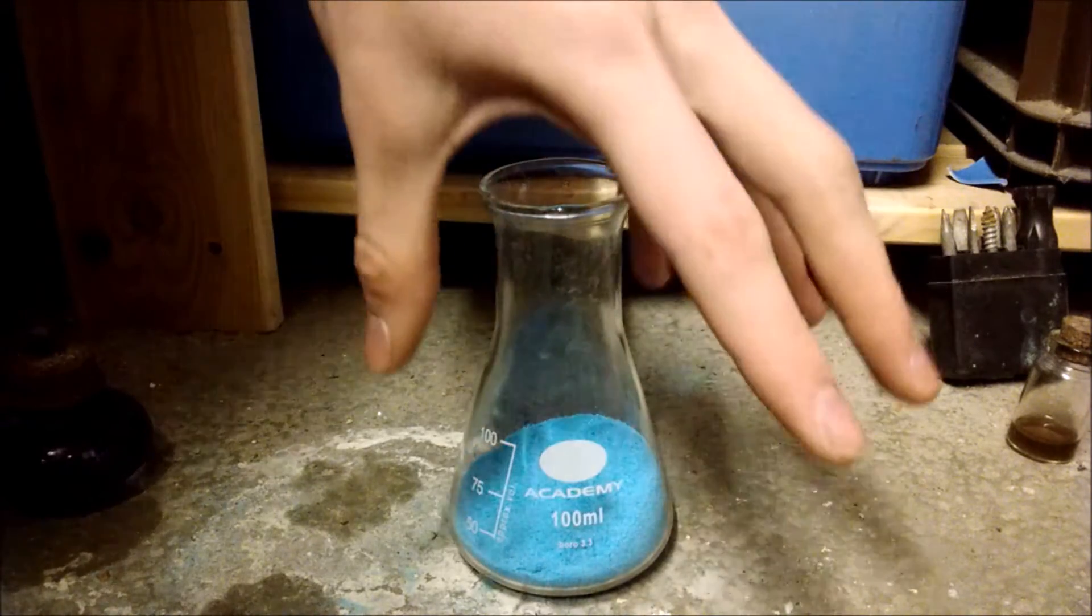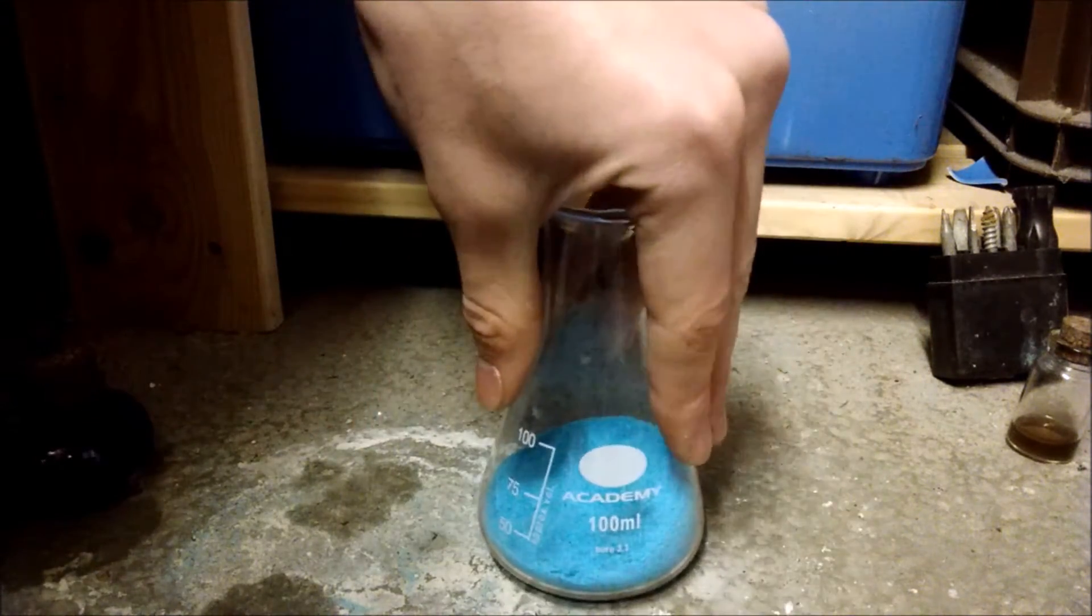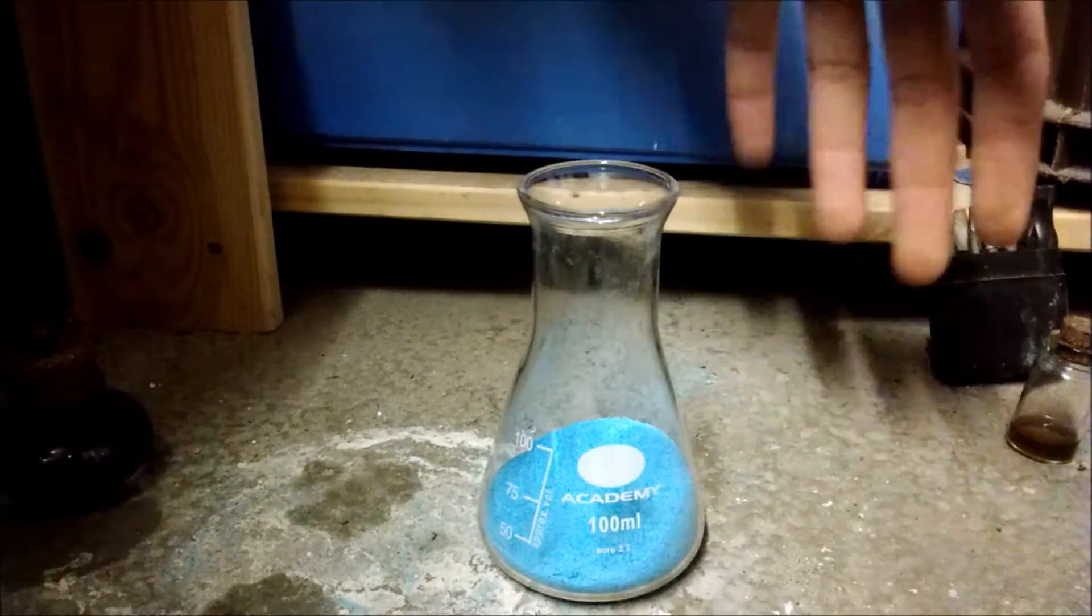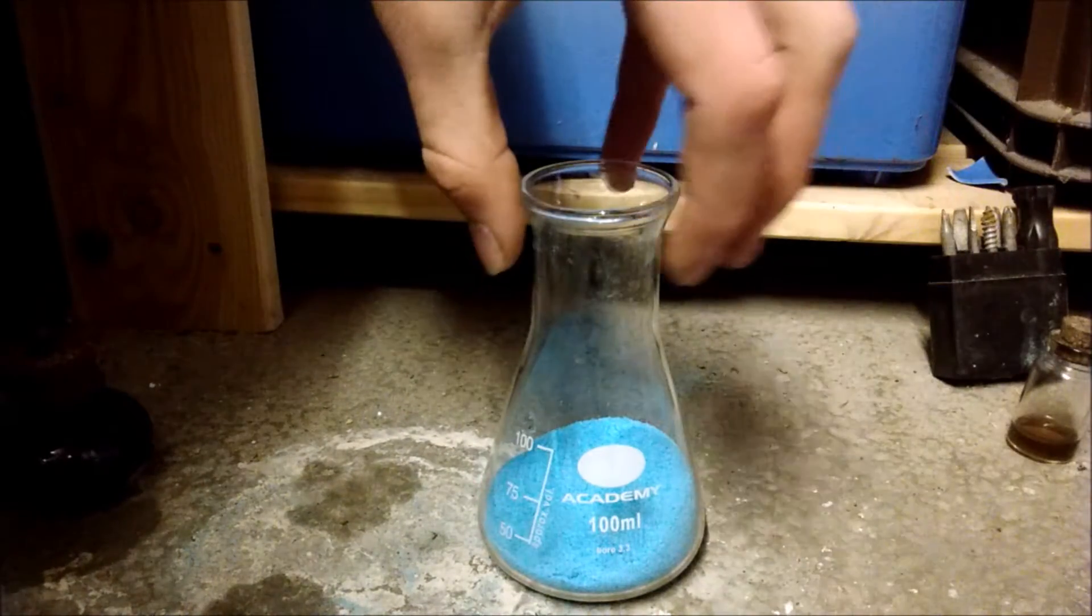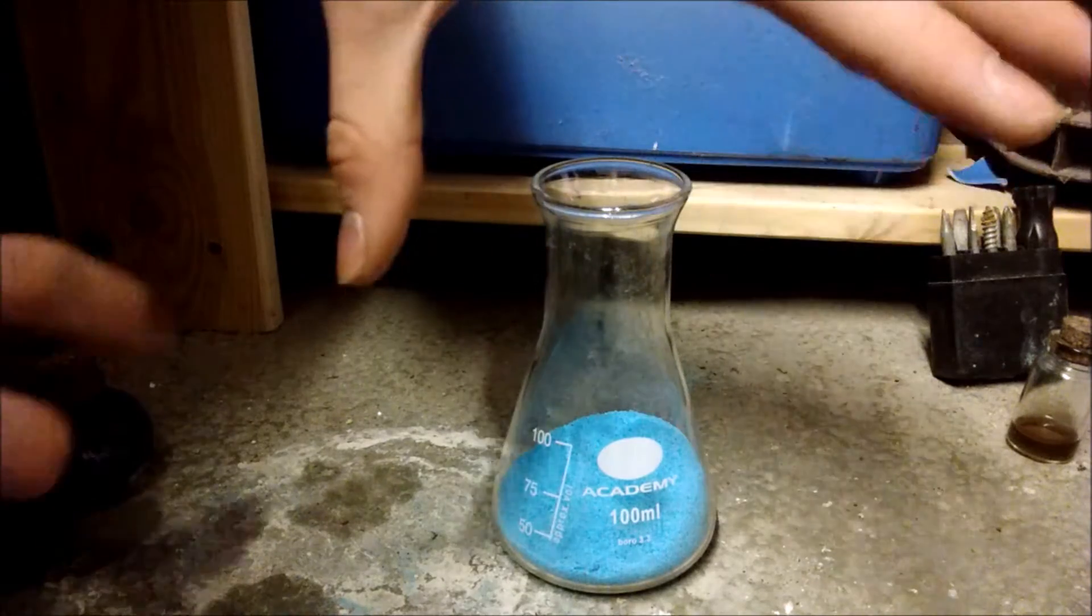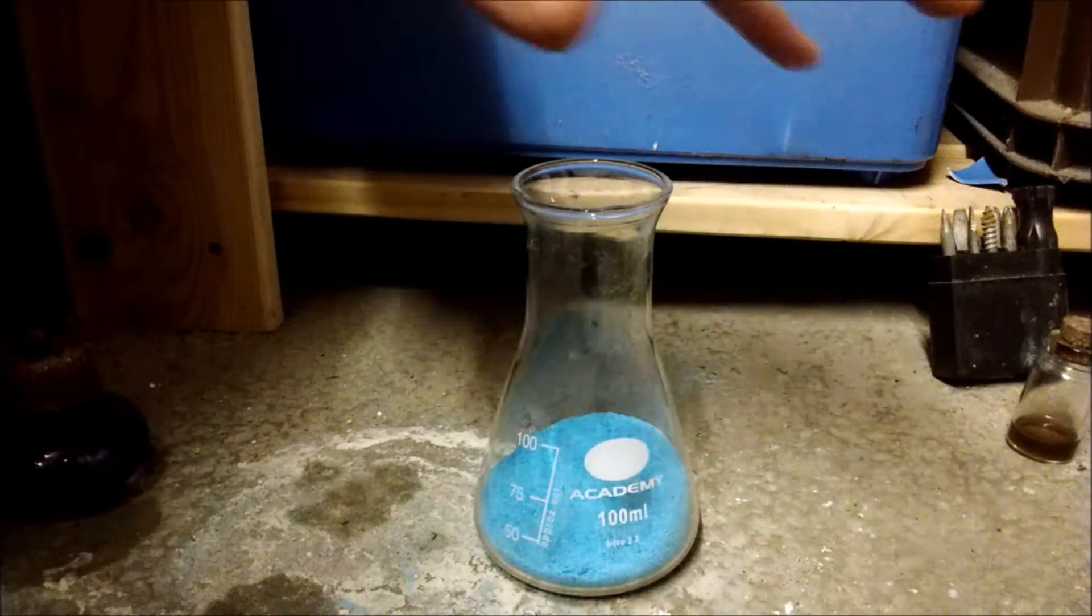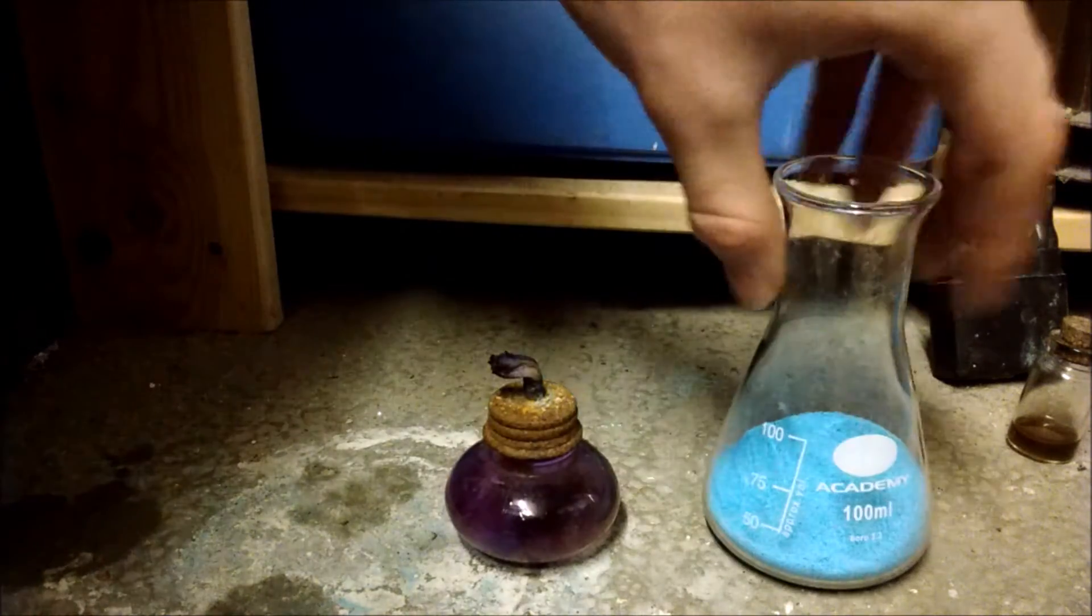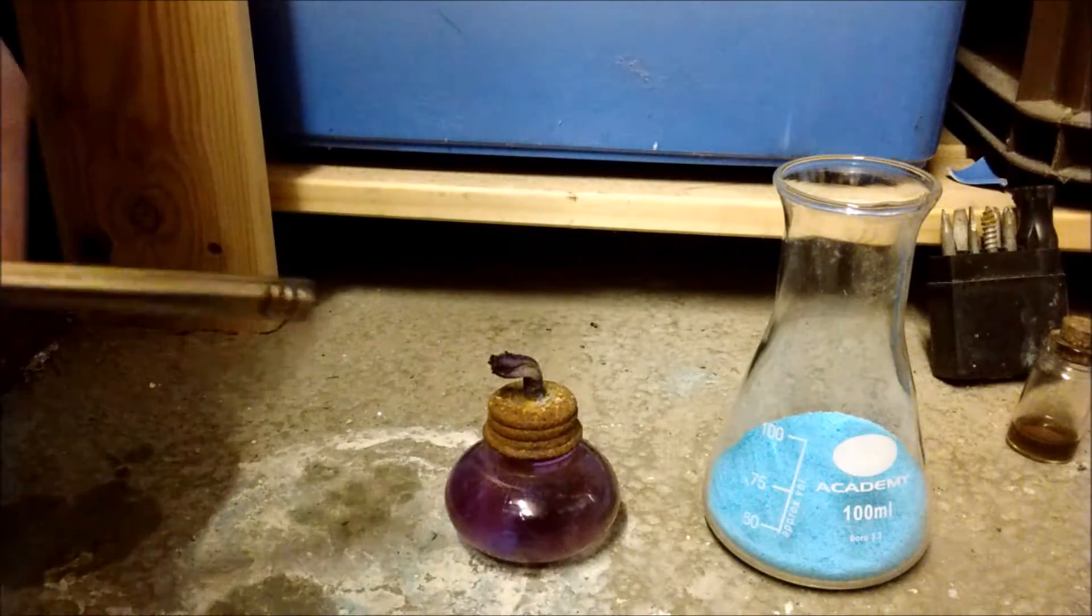So, in between all of the crystals is water molecules that are locked in. If we heat this, we will drive off the water, and it will become white anhydrous sulfate. So, I've got my little spirit burner here.